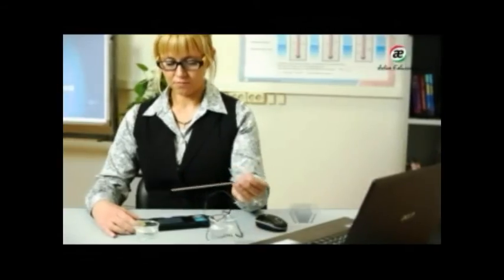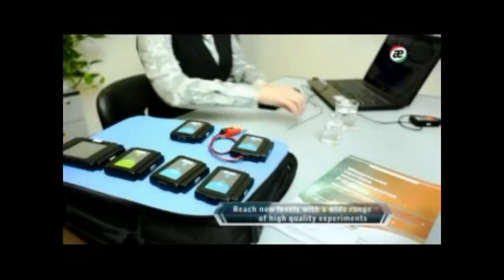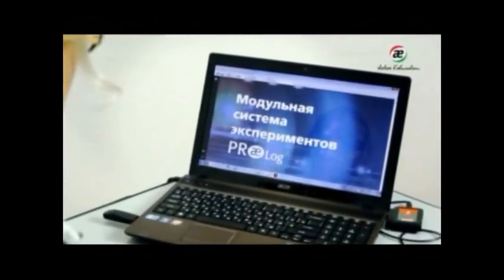The offline experiment mode expands the capabilities of the modular experiment system. With the PROLog system, you can run most experiments quickly and efficiently. The PROLog science learning system isn't limited to the above-mentioned functions. For a full description of this system, see the user manual integrated in the software.